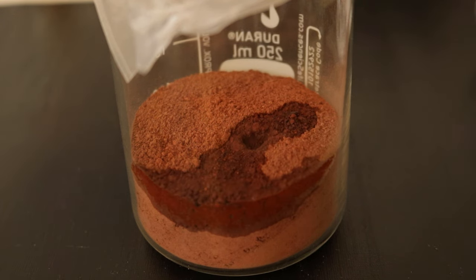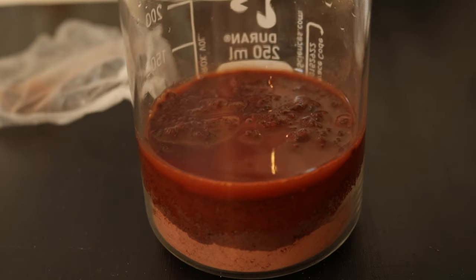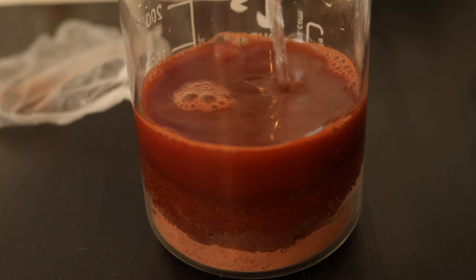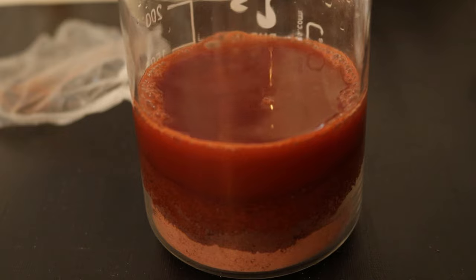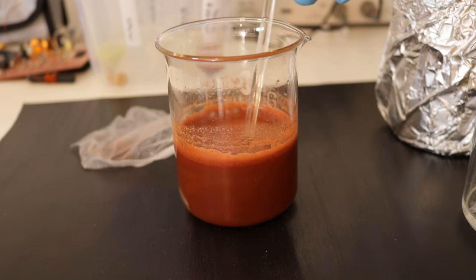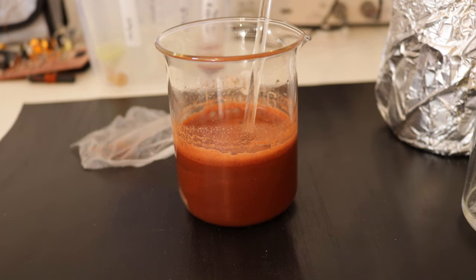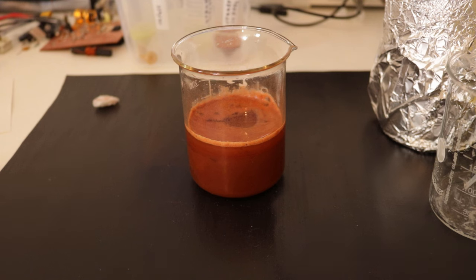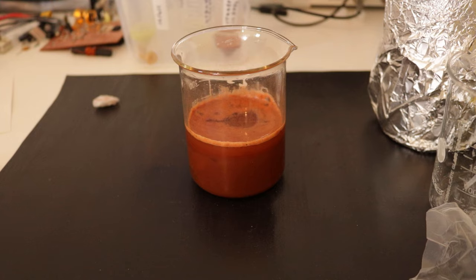This seems to be well behaved. I'm going to add a little bit more with the pipette so everything is wet and there's no dust that can go into the air, and then I'm going to add a lot more. This is going to be painful to filter. In the small scale test it settled out. I'm not sure if this foam will disappear. For now I'm going to cover this with some parafilm and then let this sit.